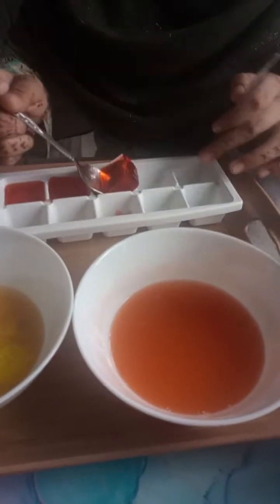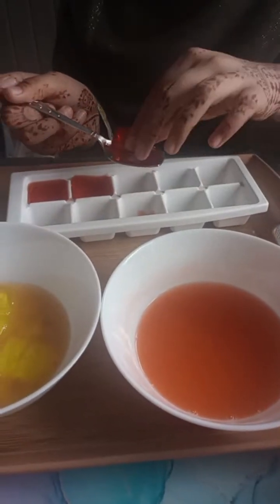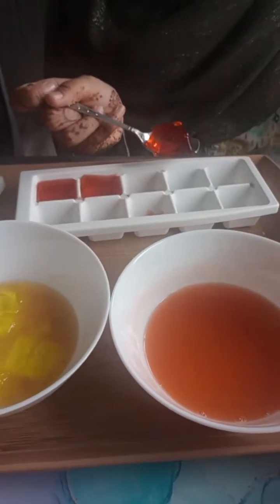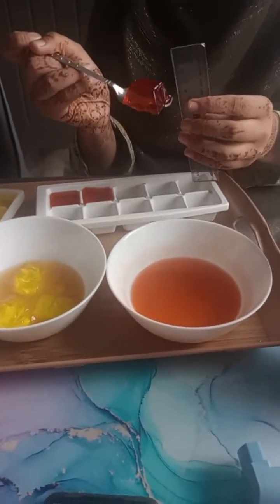It's always nice to have extra ingredients and extra experiment tools, because you maybe can use them later on. Like now, because we didn't measure it in the beginning, we could do it now. So there you go. She's going to measure that, the long side.